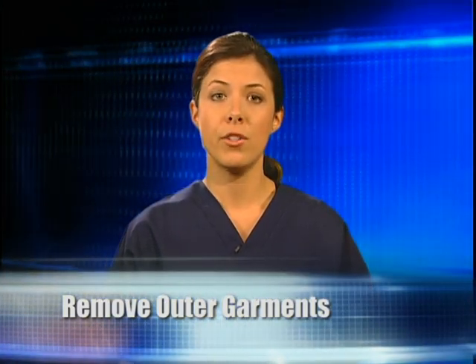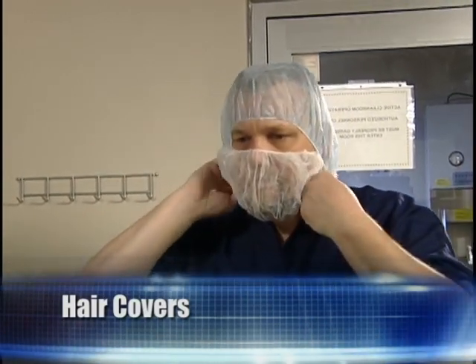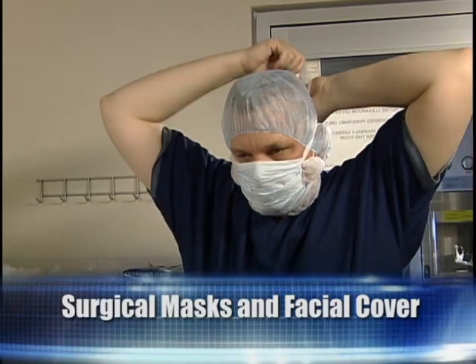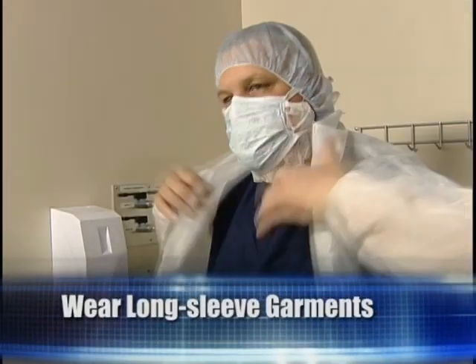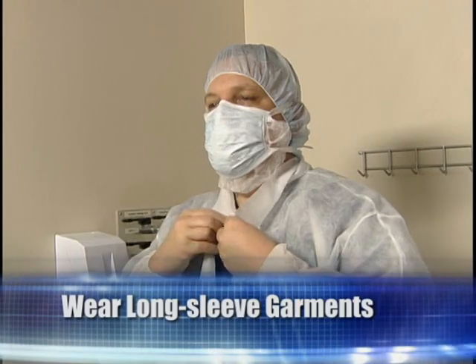Compounders should not wear artificial nails or nail polish. Hair covers should completely cover all head hair. Surgical masks should be worn. If facial hair is present, wear a facial cover. Shoe covers should completely cover the shoes. Wear a clean, long-sleeve garment that generates low amounts of particles and covers clothing.